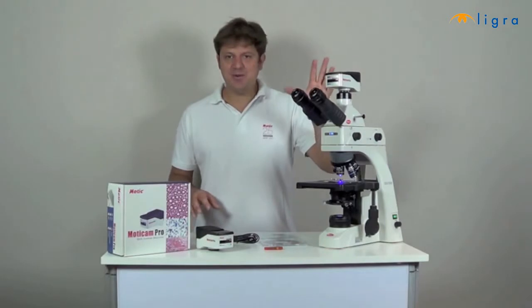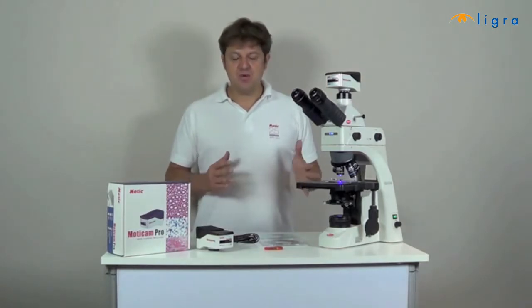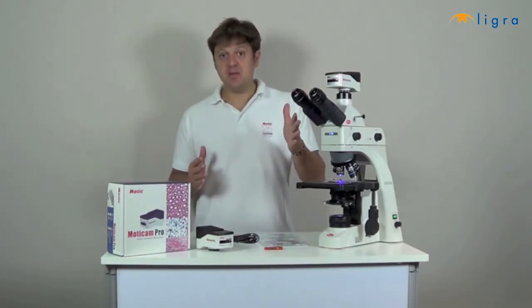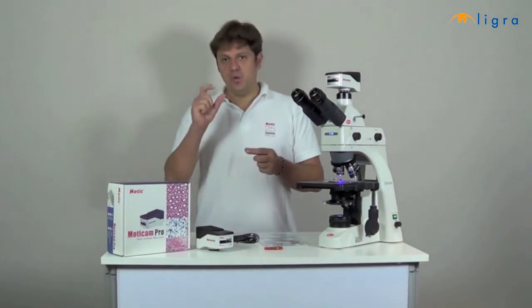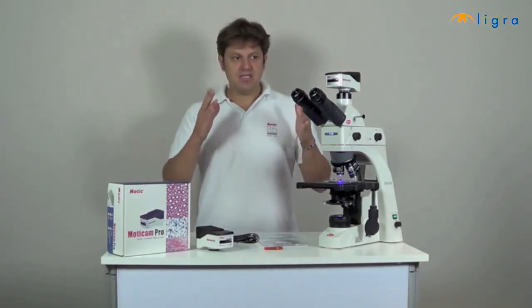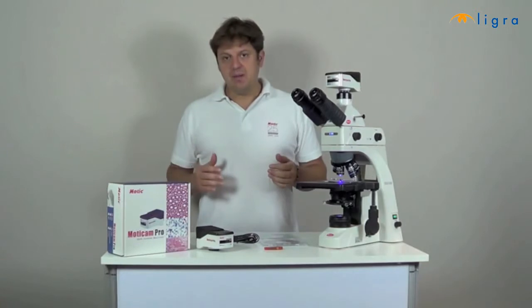Moticam Pro are cameras with a professional CCD sensor for advanced image quality requirements. There are 4 ranges with 1.4 megapixels, 3.2 megapixels, 5 megapixels and 1.4 megapixels high speed. And this high speed camera has a sensor with bigger pixels that can absorb more light. Most of the models have the choice between color or monochrome image and with or without Peltier cooling.